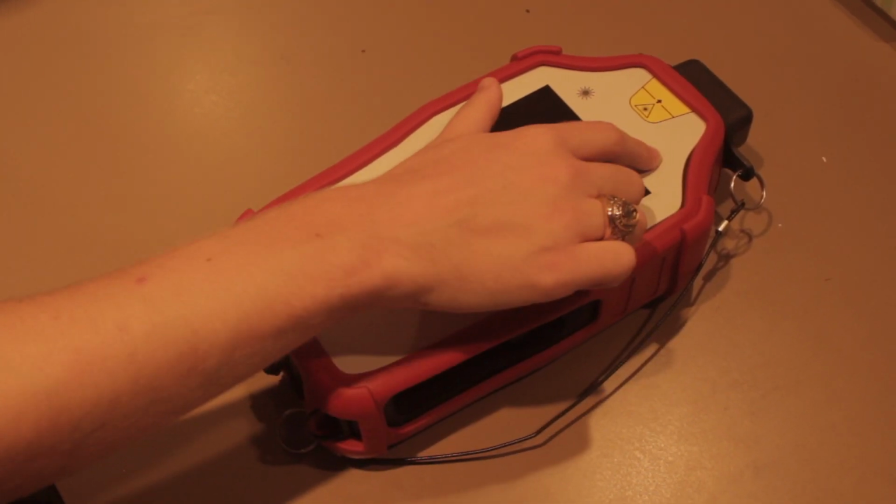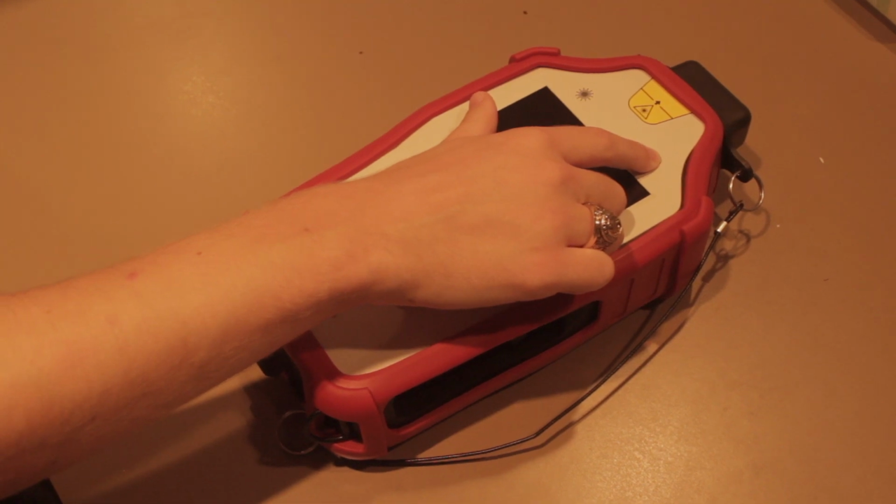Also using Raman spectroscopy, fibers are another material that can be analyzed using a handheld Raman spectrophotometer. The handheld is helpful in the field because it's lightweight and portable to different places. This is useful when having to move between different crime scenes and labs.